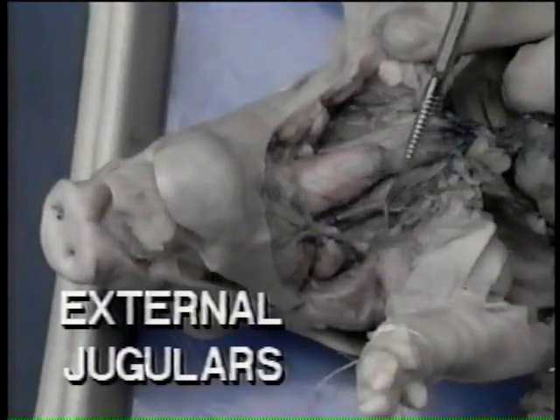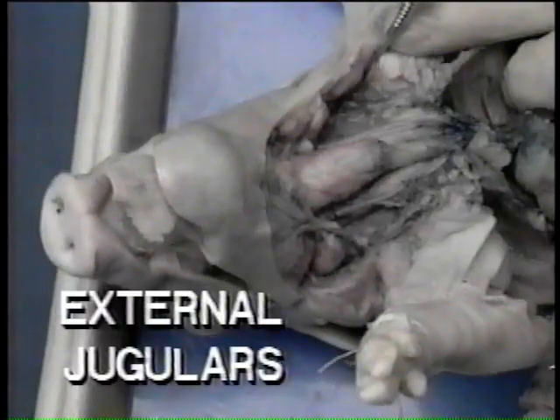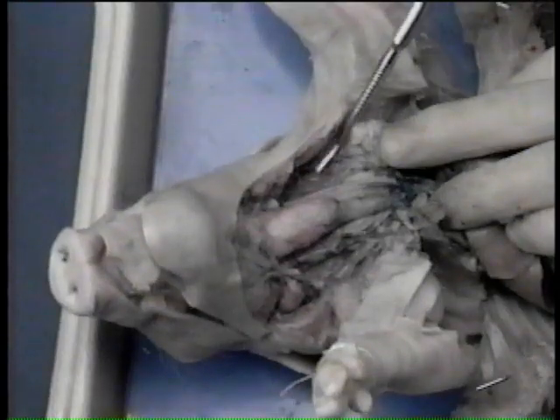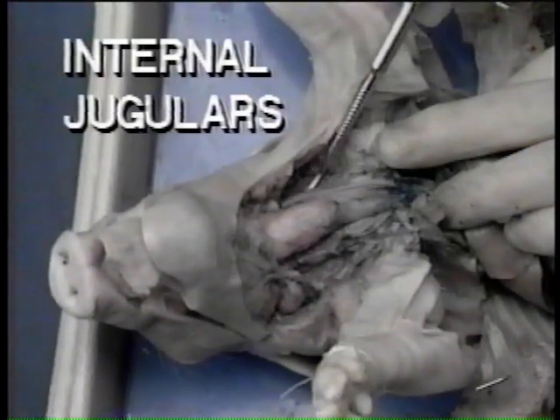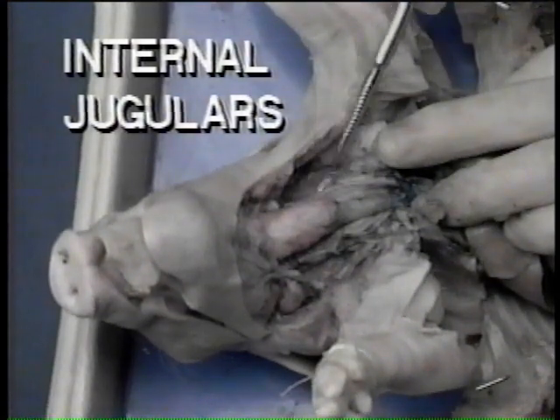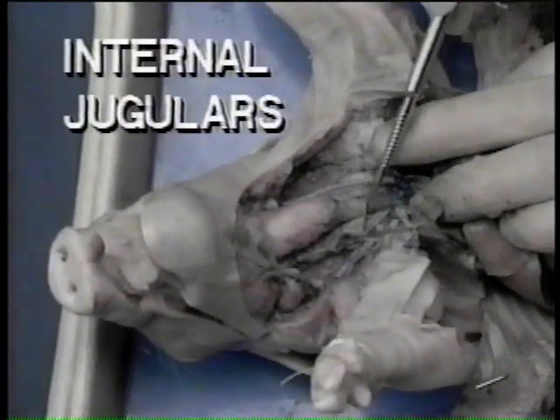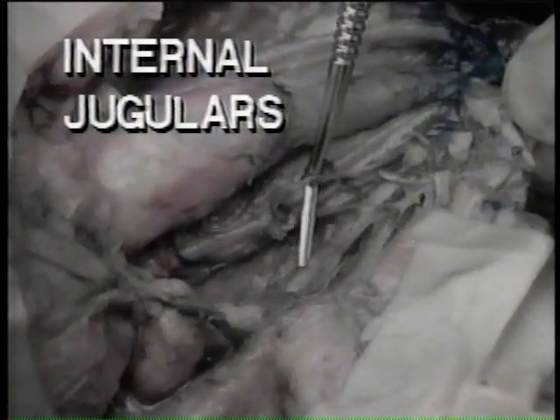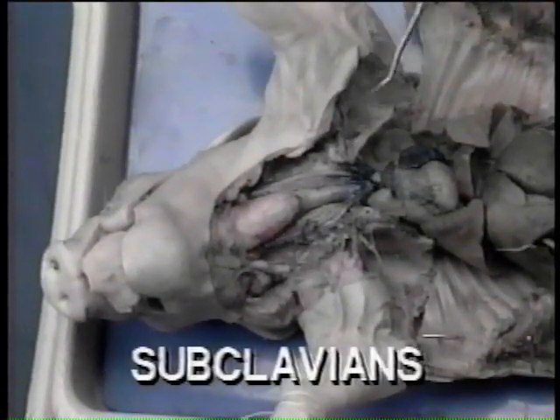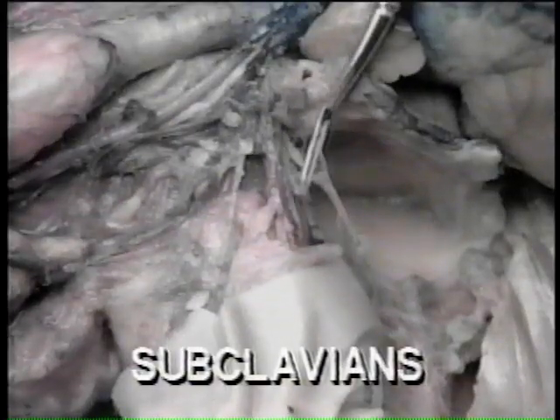The external jugulars are a pair of veins carrying blood from the head and face. The internal jugulars drain blood from the brain. The vessels coming from the forelimbs are called the subclavians. They enter the brachiocephalic.